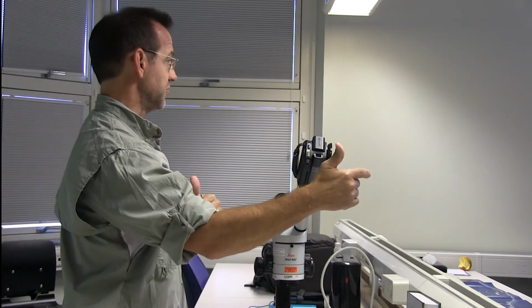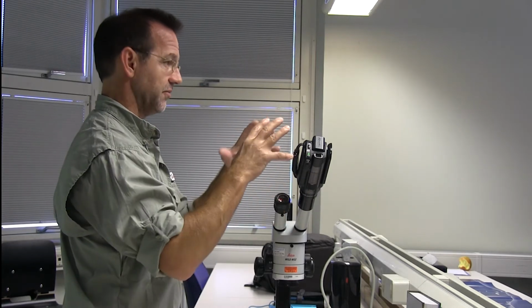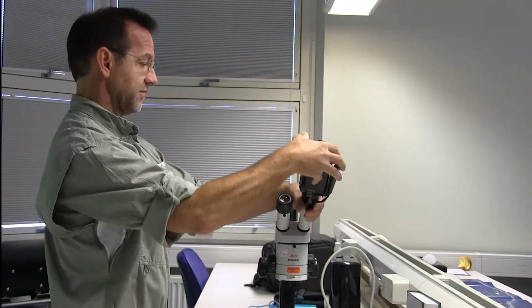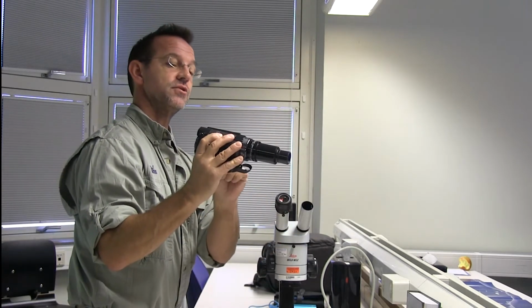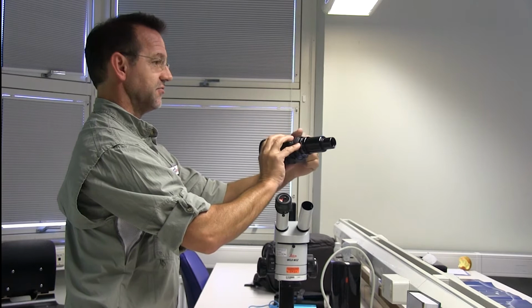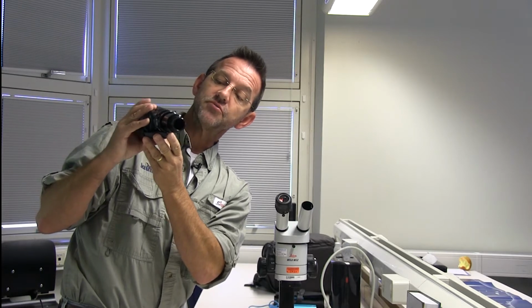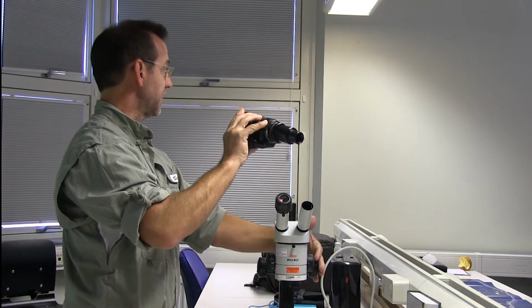So this afternoon, when we're doing our sampling and looking at the live samples under the scope, I'll show you exactly how that works. But this is an older system. That's how this camera system works right here. And when you take it out, you can kind of see the circle there, because you have this vignette here. This is much smaller than the lens of the camera. So to get rid of that, you would have to zoom in like this to fill the screen, like that. So that would give you the image under the scope then.